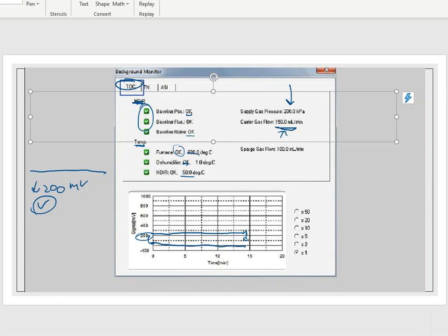And I told you on the software screen, there is a number, and that number is 200. And I want to make sure that I am within plus or minus 10 of that value. Well, there is the pressure. There's the system setting that it wants. So if it begins to look at this pressure that's incoming, and if it goes lower than 190, or if it goes greater than 210, then this could give me an error that's associated with the machine, and it will not run any sample at all, period.